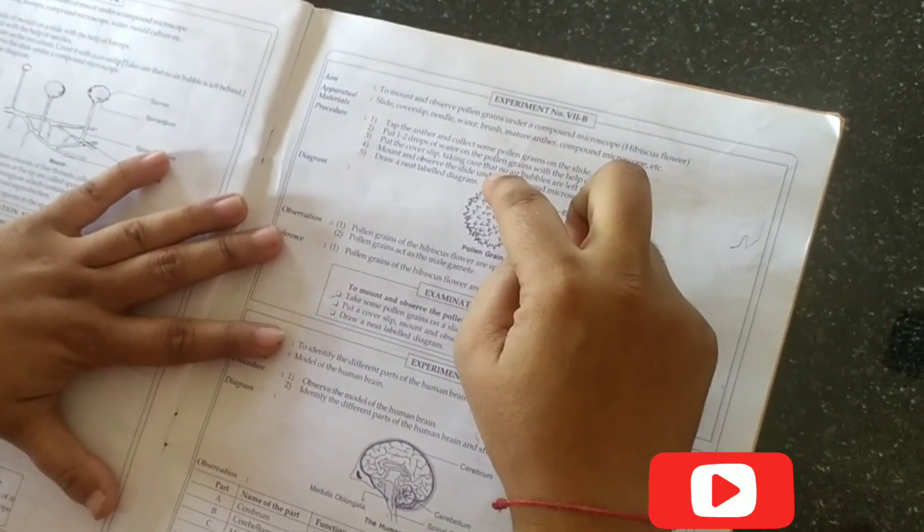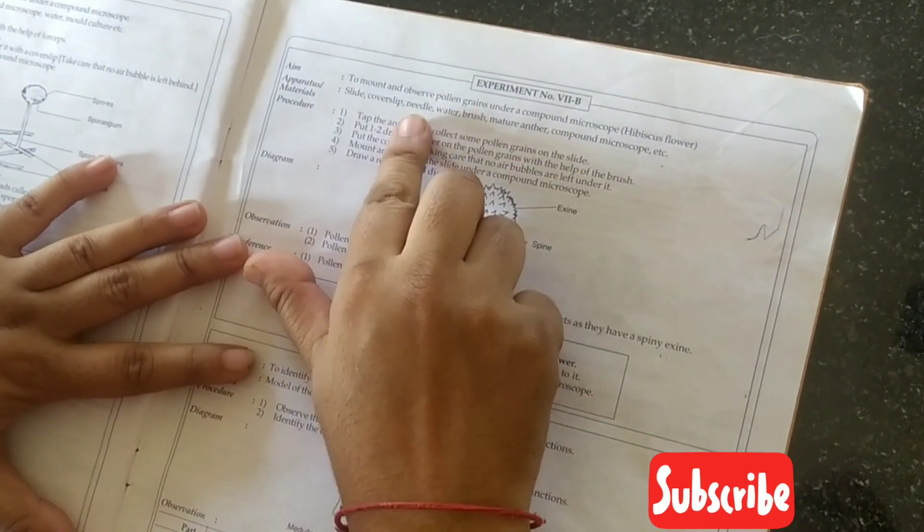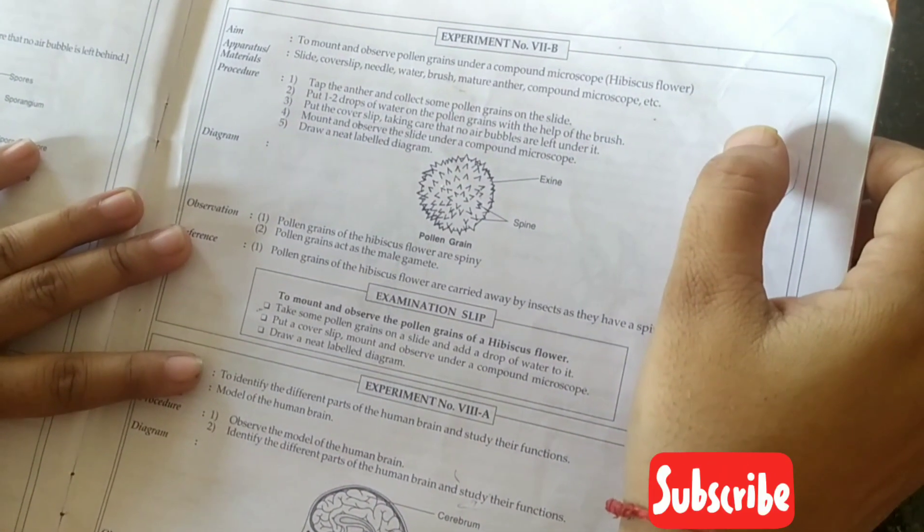The anther contains pollen grains, which are the male gametes. Today we are going to observe these pollen grains under a compound microscope. This experiment is taken from standard science practical — experiment number 7B. The aim is to mount and observe pollen grains under a compound microscope, using a hibiscus flower.